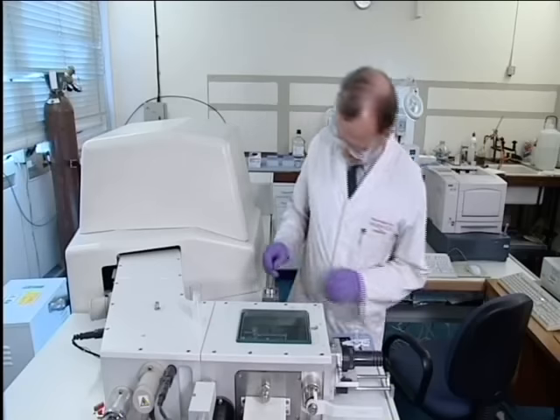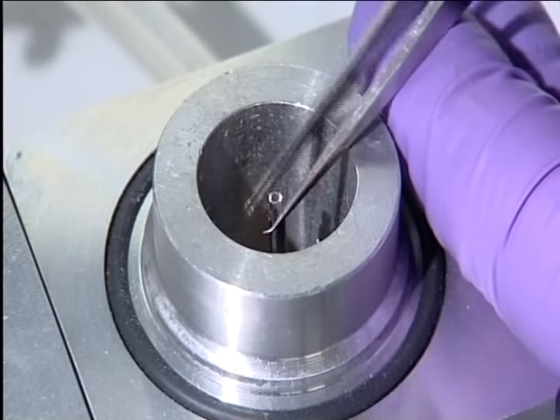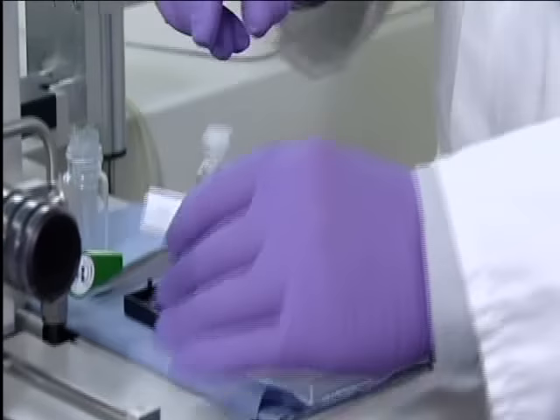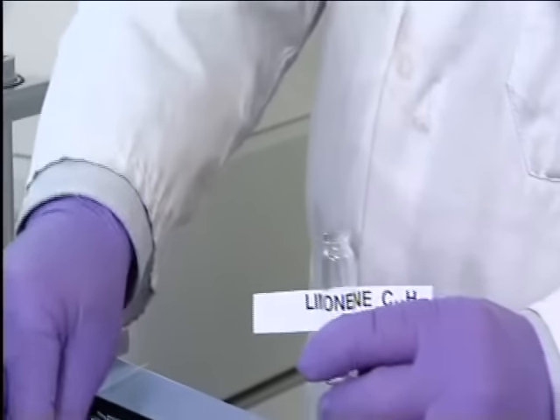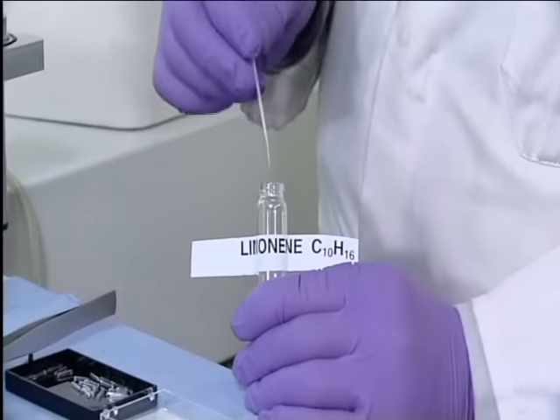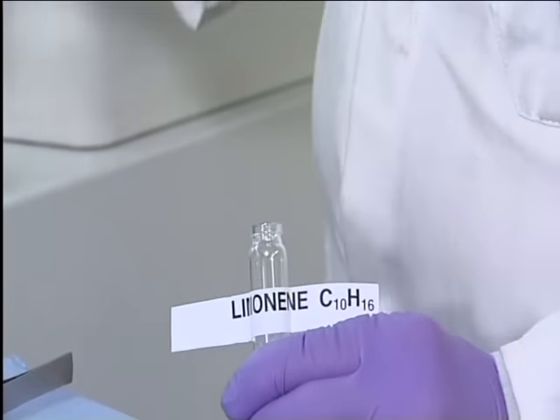Liquid samples are placed in the tiny sample tube as shown. Here we're running the mass spectrum of limonene, an alkene which can be obtained from the peel of citrus fruits. Only a little is required — mass spectrometry can detect down to as few as 10 to the minus 12 moles.